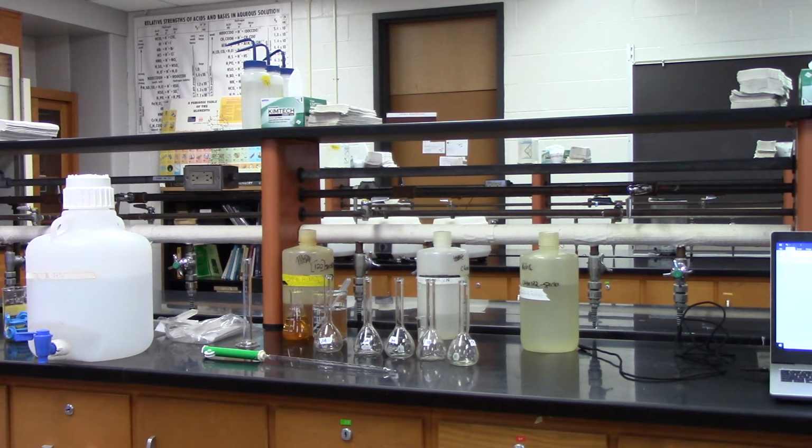And using Beer's law, which we talked about in intro spec lab, we can come up with the relationship between concentration and absorbance. And once we do that, we do the experiment, we measure absorbance, and then if we know absorbance, we can figure out concentration. So this first video, I'm going to make the calibration curve.